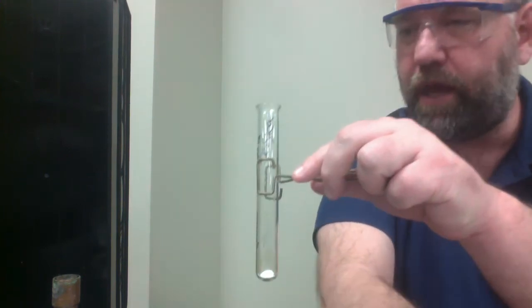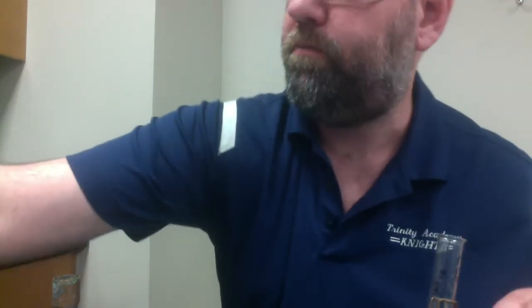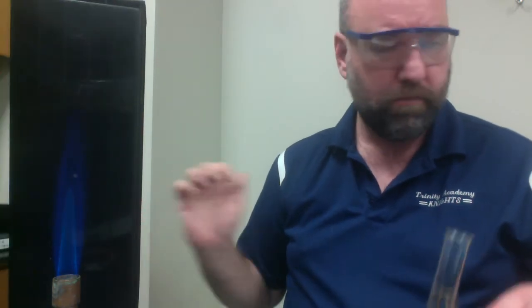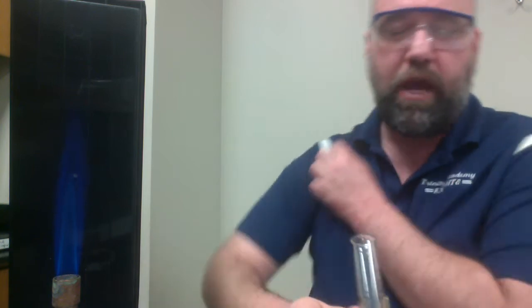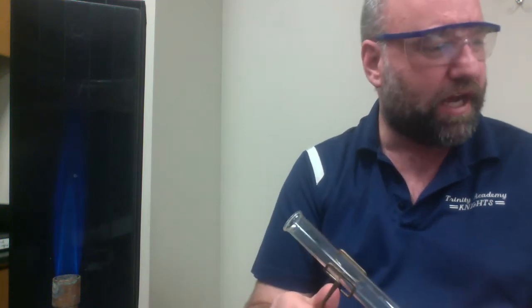And then we will heat this over a Bunsen burner flame. So I will now light my Bunsen burner. Okay, it says on our handout here, let me read this to you. We're testing specifically for an odor on this one, and that obviously we can't do via internet. But I will explain what it's similar to in just a second.